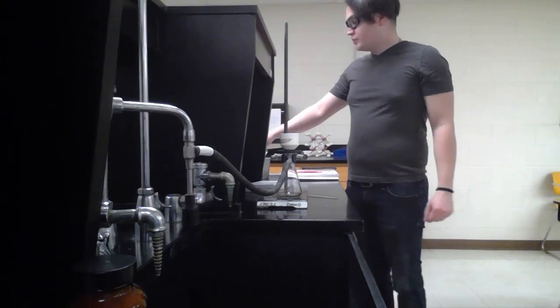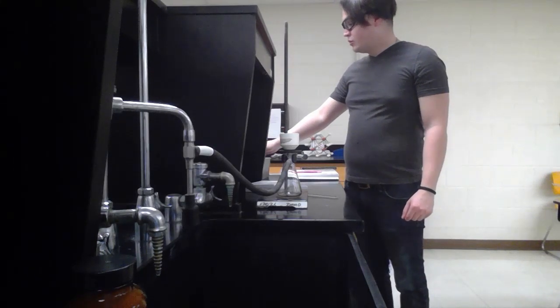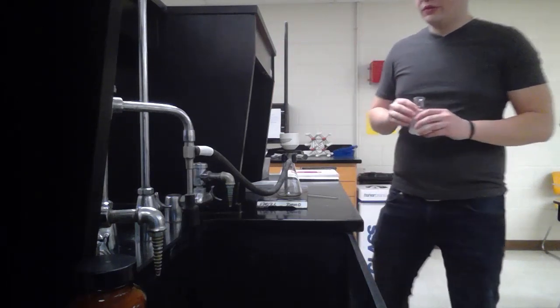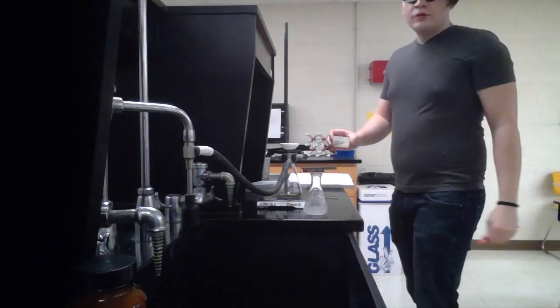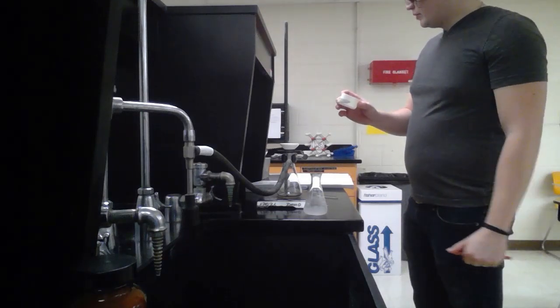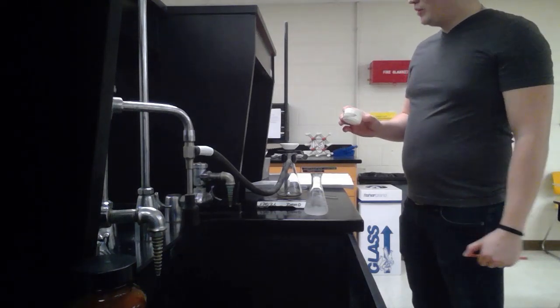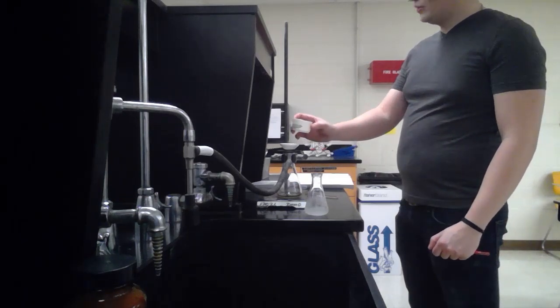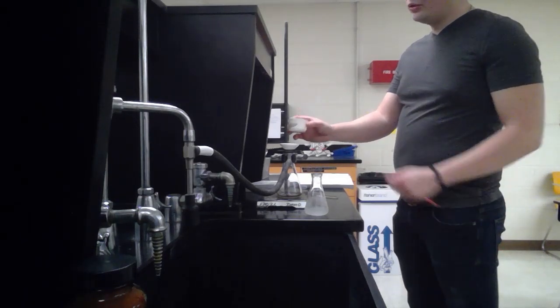Our aspirin reaction flask is for the most part cooled down, so hopefully we have enough solid in here. We're going to filter this using the vacuum filtration system. Earlier we weighed the top of the Buchner funnel with the wet filter paper, and this portion weighs 15.22 grams.